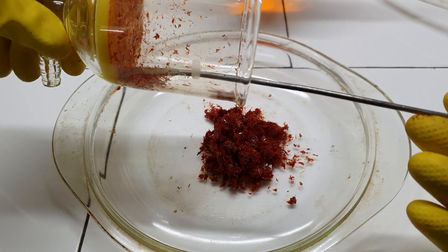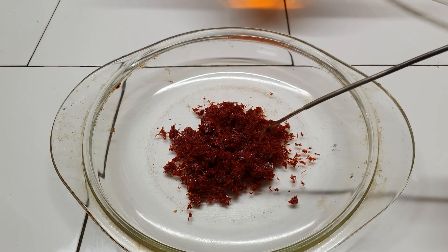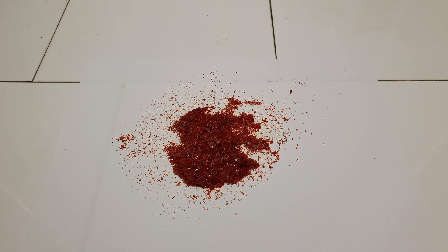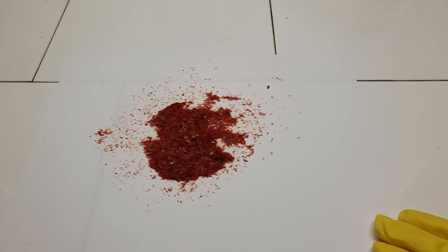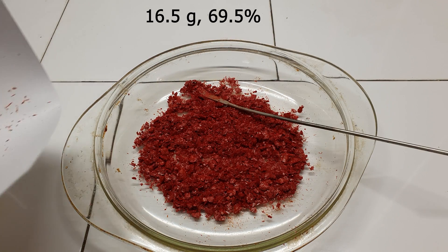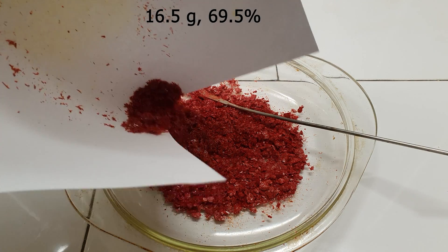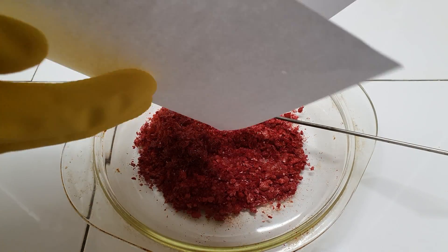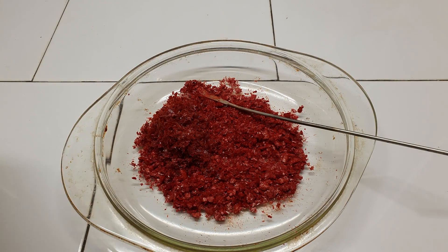After all, when you use it, you need a solution of it. I am letting it dry here because I want to demonstrate how the pure compound looks. As you can see, its crystals are very nice, beautiful, and red. I didn't have enough butanol to do the recrystallization at once, so I had to repeat it 3 more times. My yield was 16.5 grams, which corresponds to a percent yield of 69.5%. This is not bad, and 16.5 grams will probably be a lifetime supply of this reagent for me, so I was pretty happy with the result.